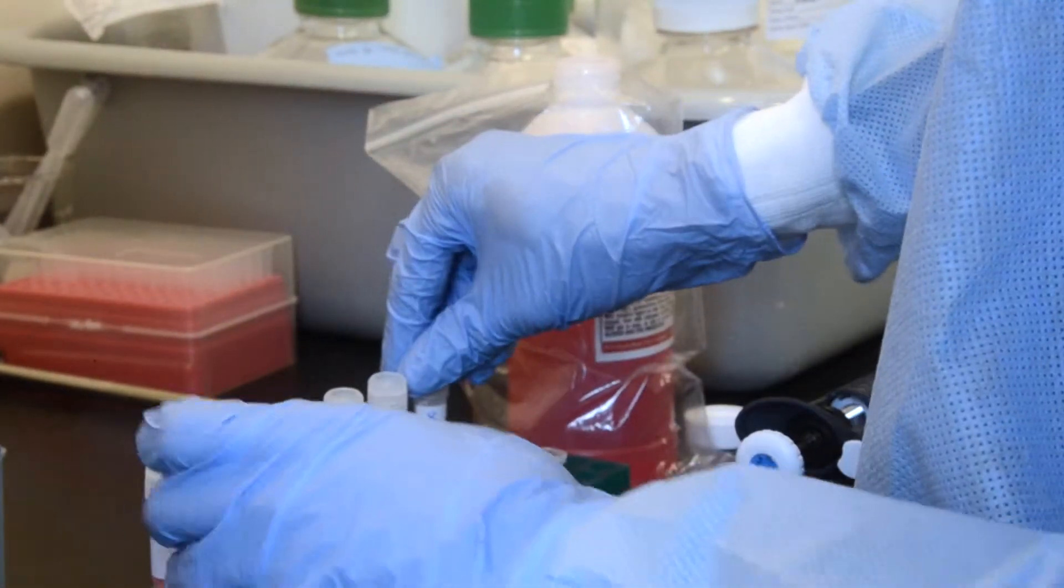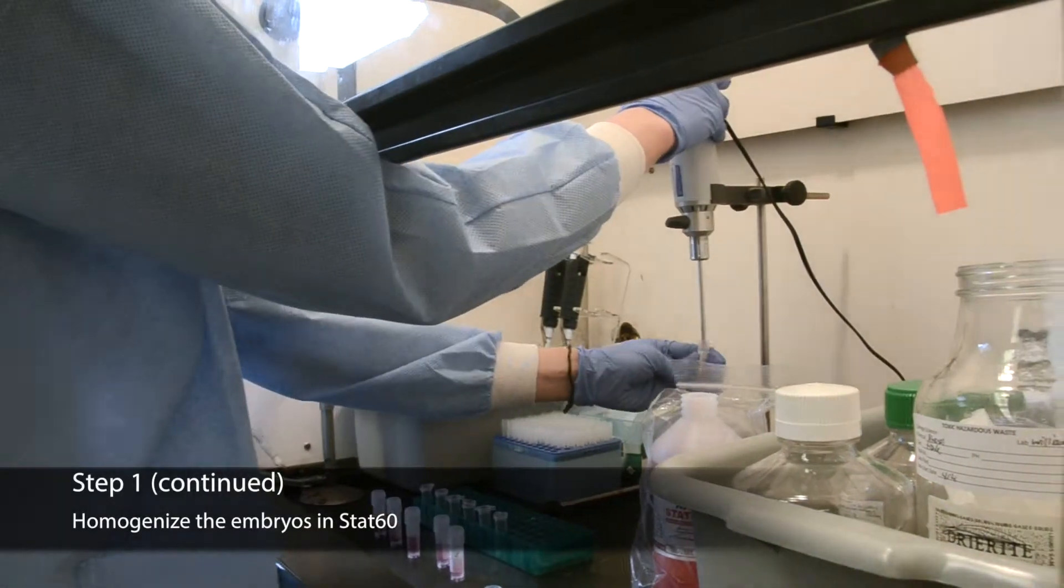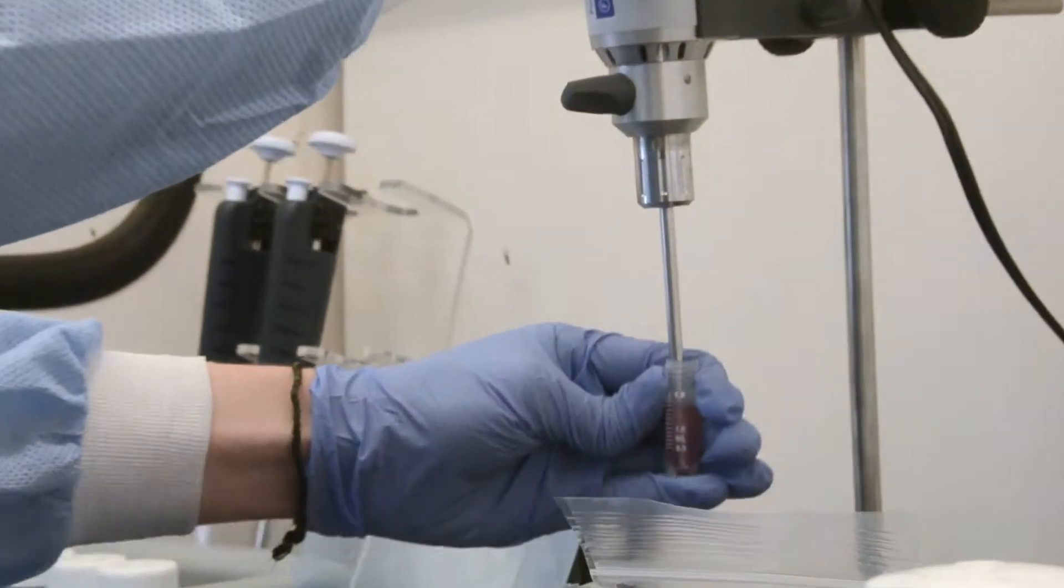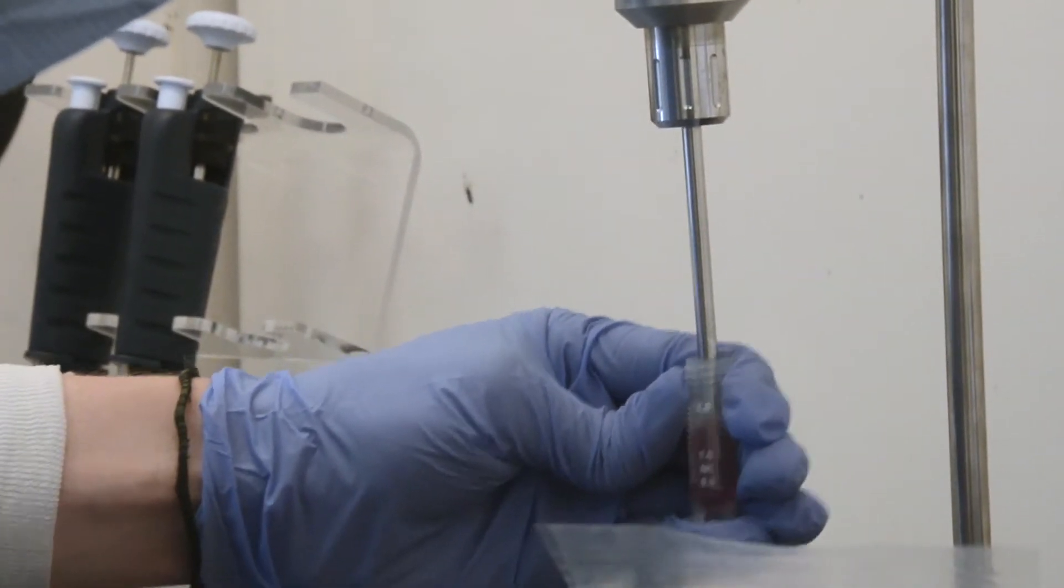If any STAT60 is spilled, immediately notify Larissa. Homogenize the embryos in STAT60 until the embryos are blended into solution. Make sure that the embryos are in the solution and do not get stuck on the side of the cryovial.